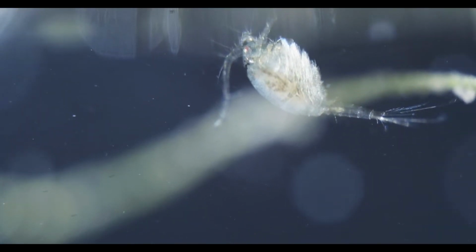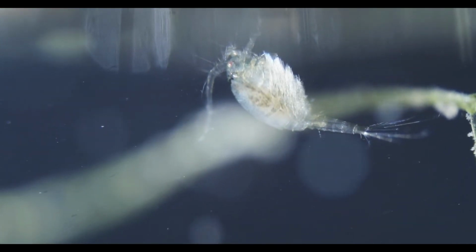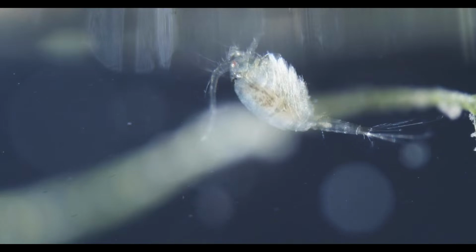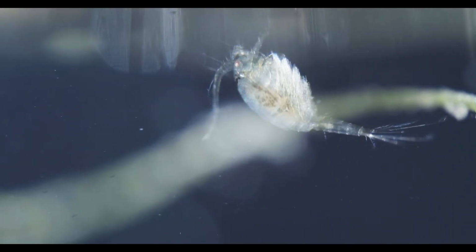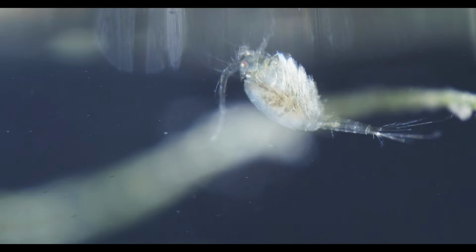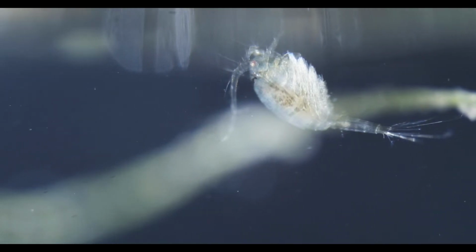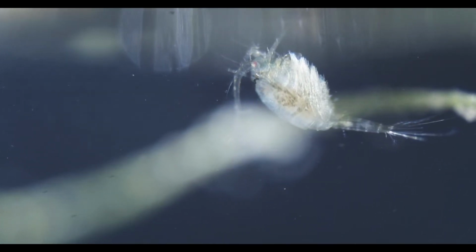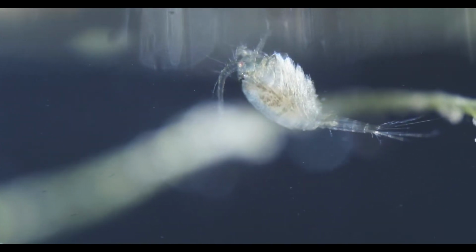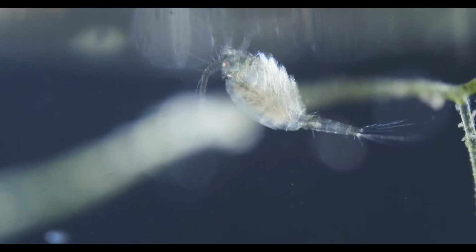Here you can see the underside of the copepod and their feet, which are the rudders they use to move around. It's not the antenna, as they might be using their antenna too for locomotion, but this hopping movement they usually do, they do it by beating their regular legs that are pointing up right now.